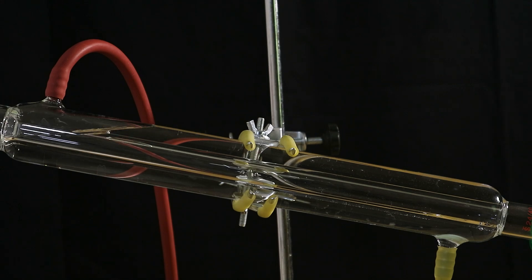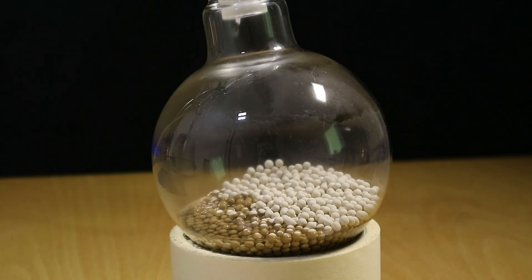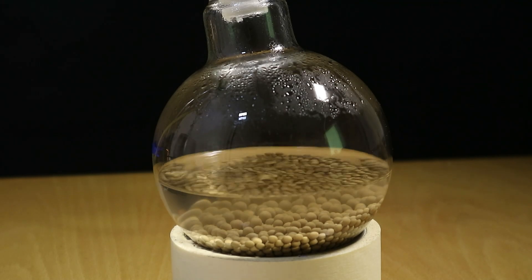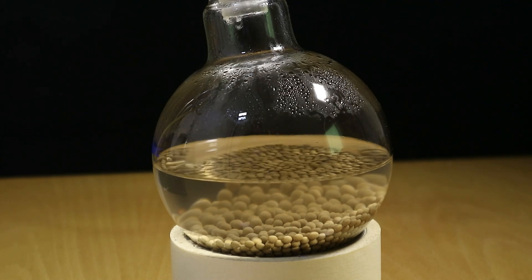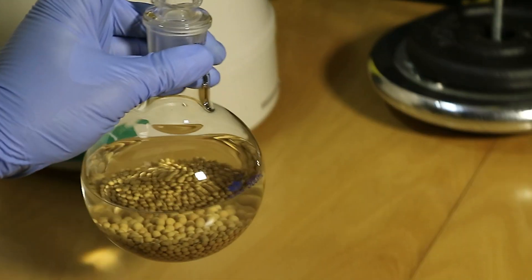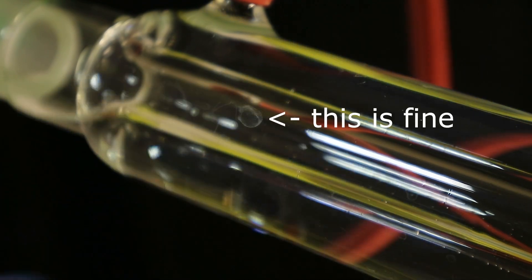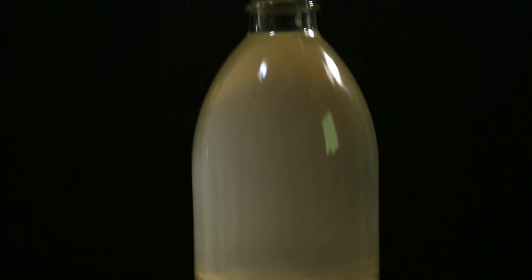So I distilled a third time the ethanol over these newly dried less dirty sieves and thinking that it should be fine now you know like they've been cleaned twice. But no of course not it's as fine as the dust itself. Actually it's the opposite of that. It's as not fine as the dust is fine.